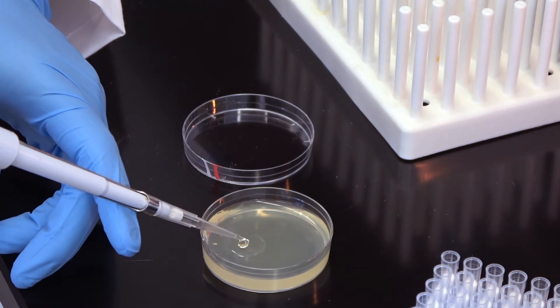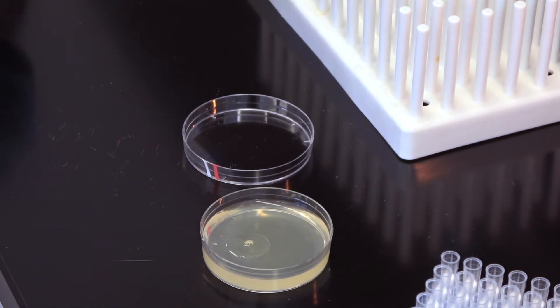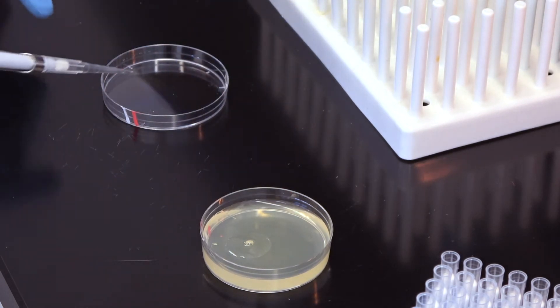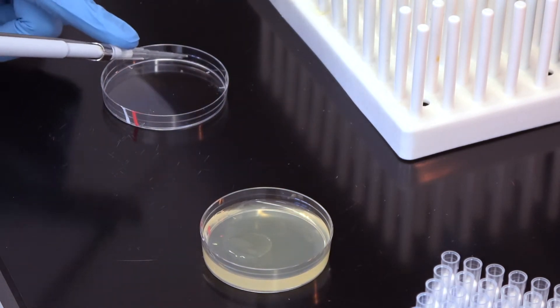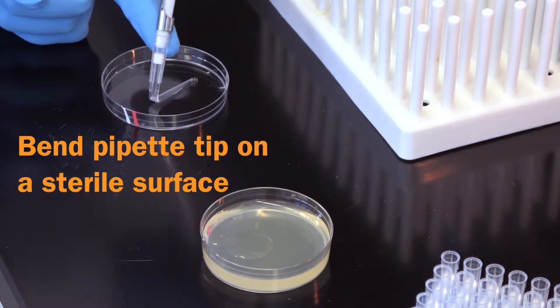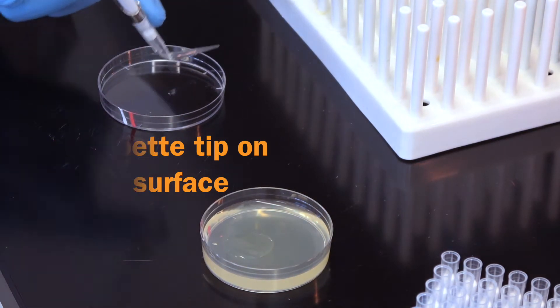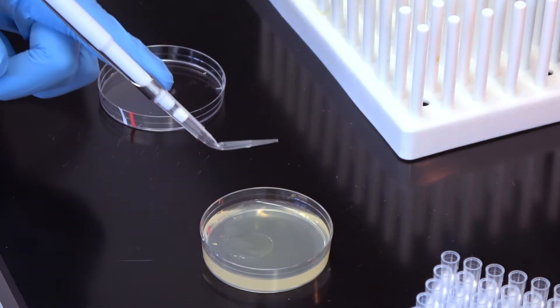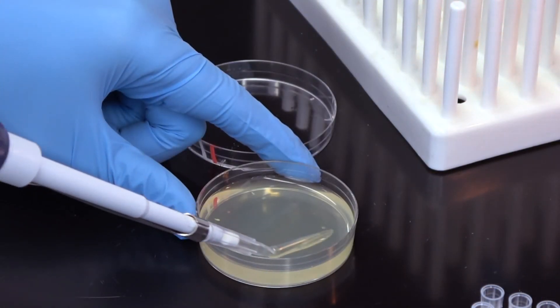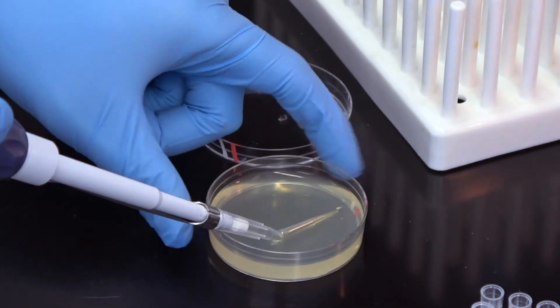Now we must spread the antibiotic over the plate. You could do this with a sterile glass spreader, but we find it is easier and faster to use a pipette tip. Gently bend the pipette tip into an L shape, then touch the bottom of the L to the plate and gently swab the pooled antibiotic over the entire surface of the plate.